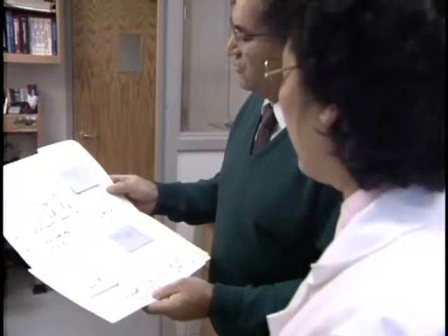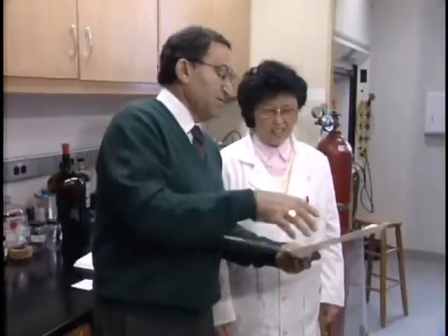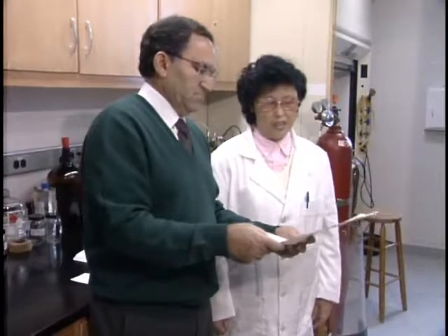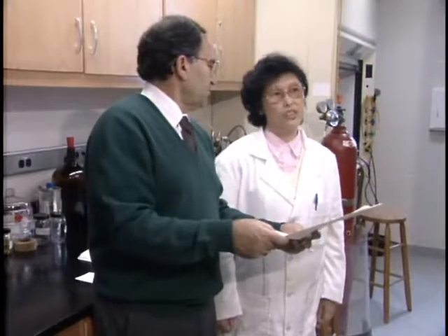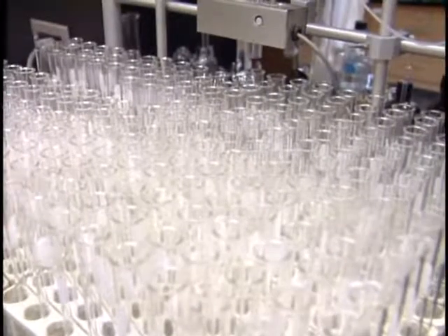And nobody has reported this one, right? This acid. Now the TLC is pure and the NMR is pure. Now we will get the MS spectrum. And do you know what the yield is? Oh, the yield is good, about 80%. About 80%. That's very good. The student will take it.